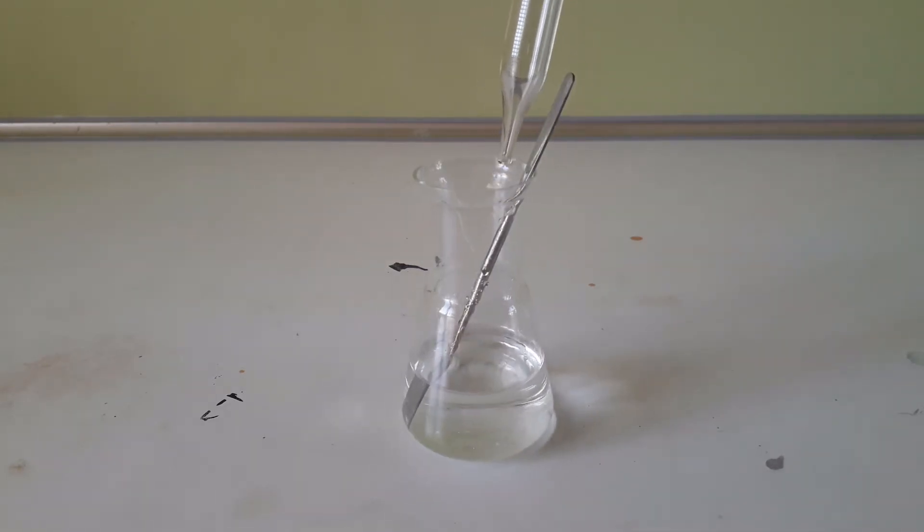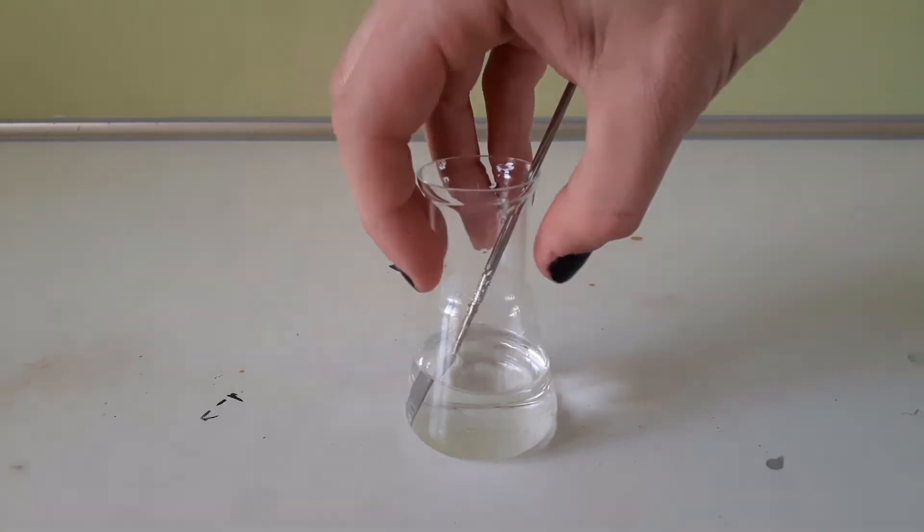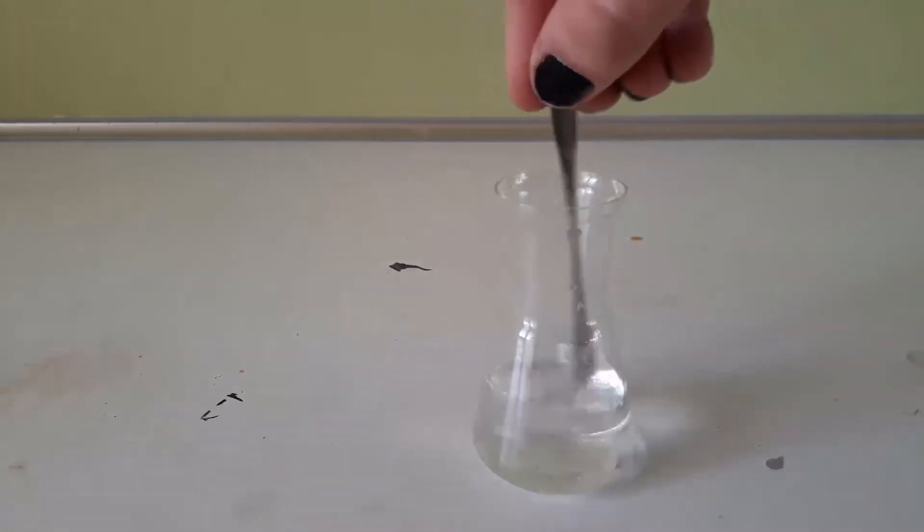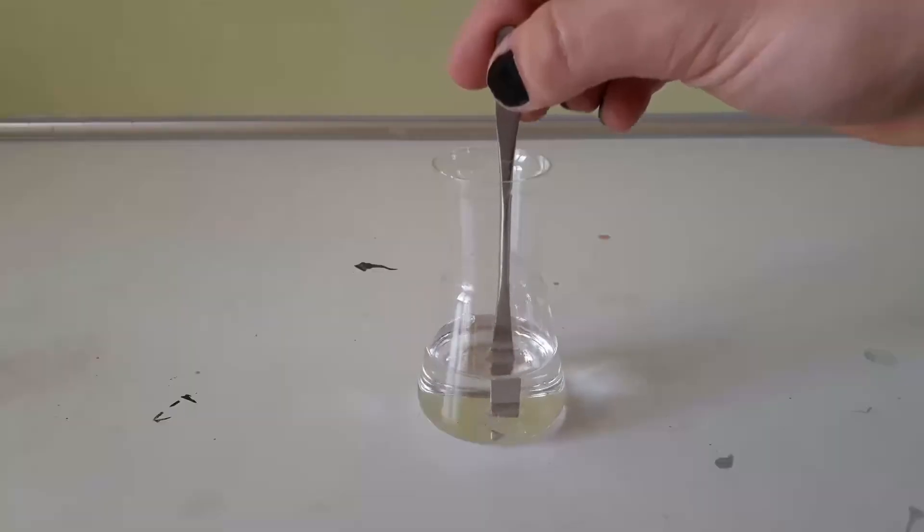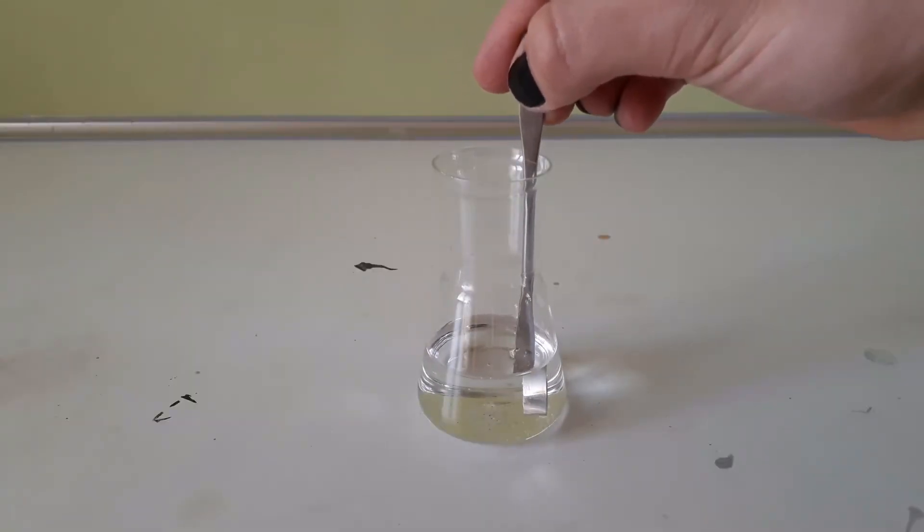In toluene, which I'm using 35 ml of, the anthracene is only just about completely dissolving. It takes quite a bit of effort to get everything into solution.